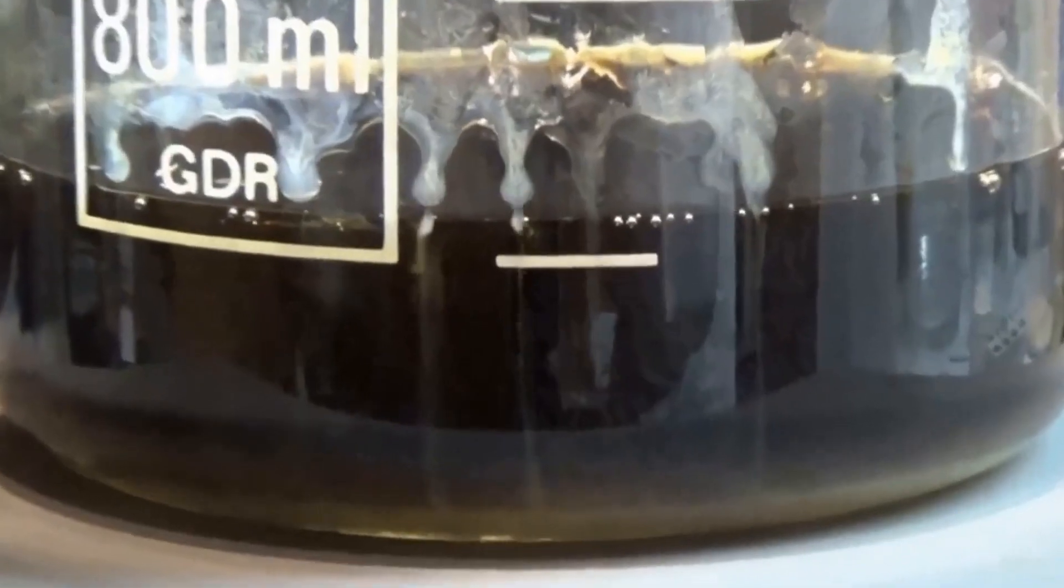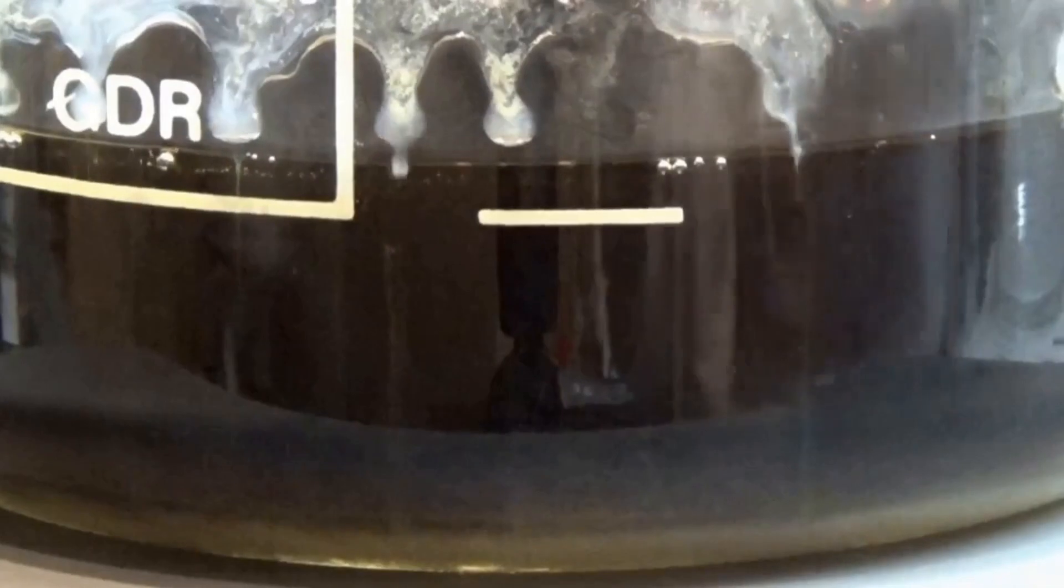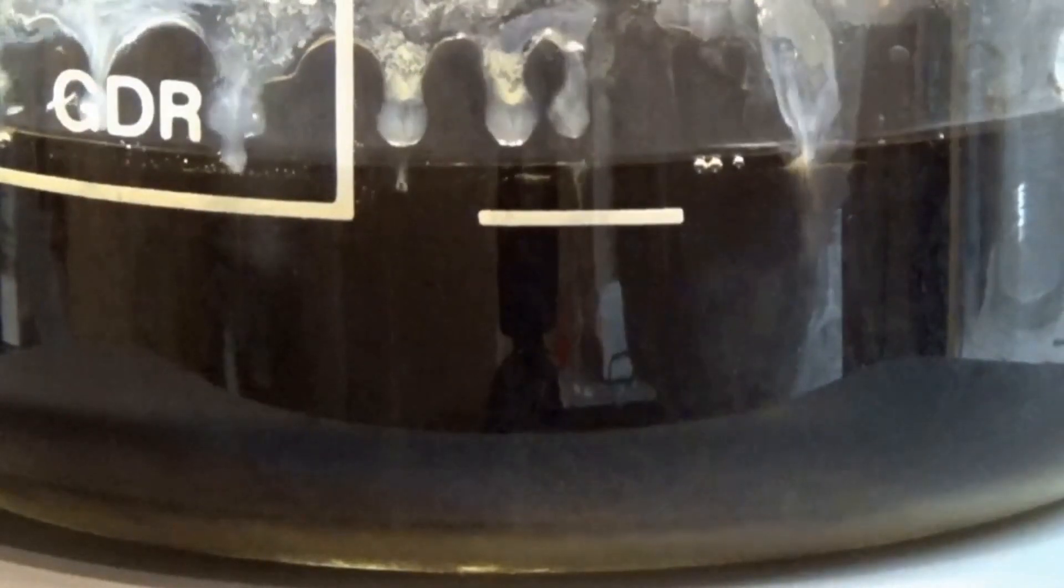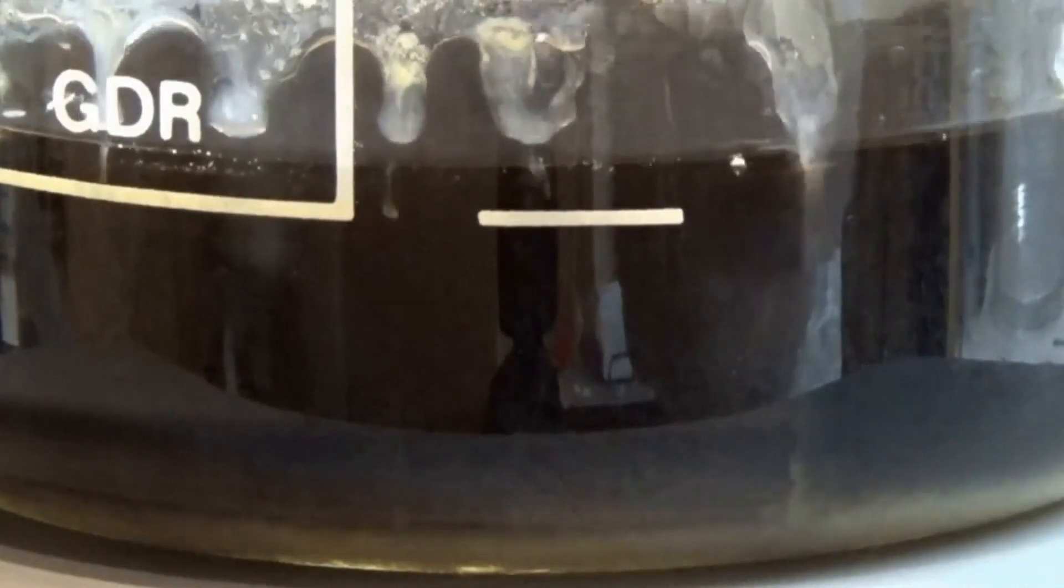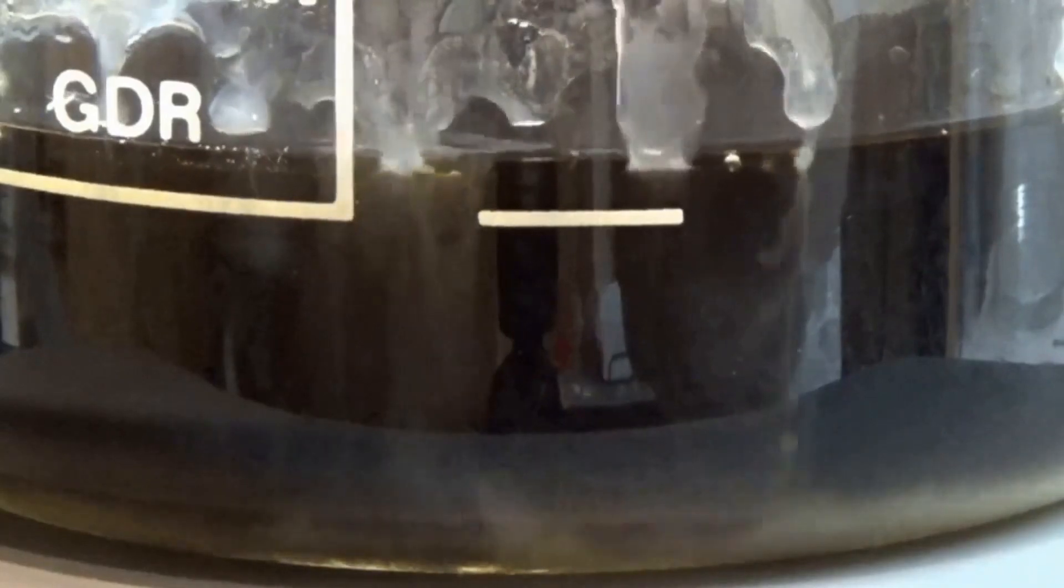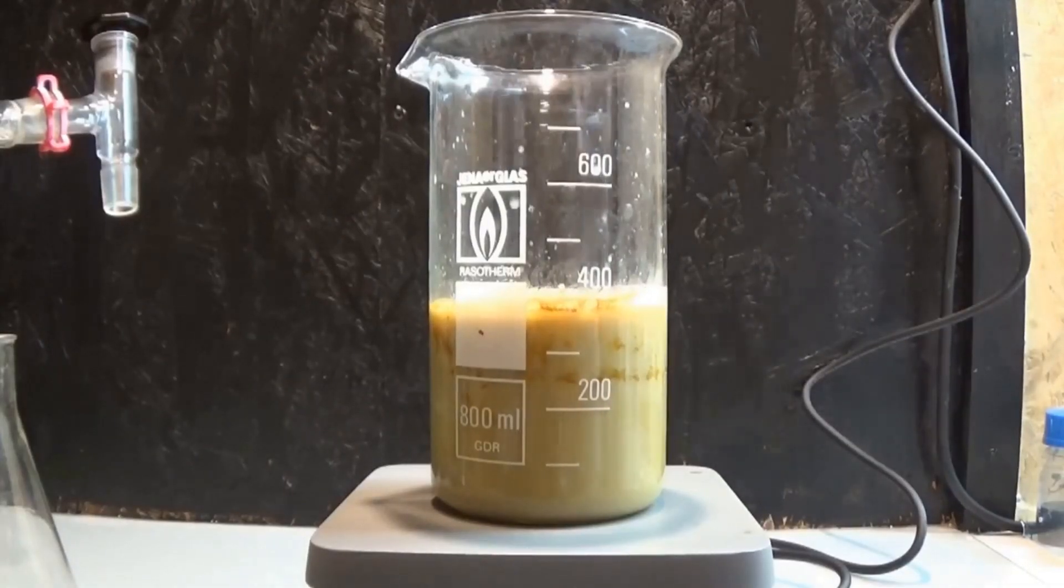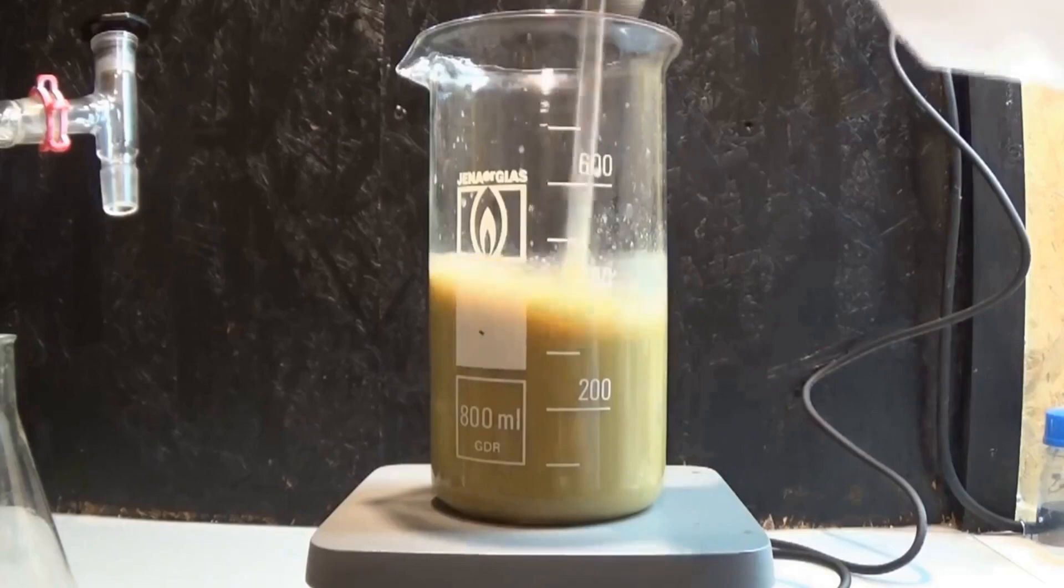I know that through the display, and especially with my old camera, it doesn't seem like it, but I find the way the crystals are coming out of the solution very interesting and beautiful. After no more cloudiness occurred, I gave the mixture a good stir and put it into the freezer for 12 hours. This is important: it gives the piperine enough time to clump into bigger clusters of crystals which can be filtered.